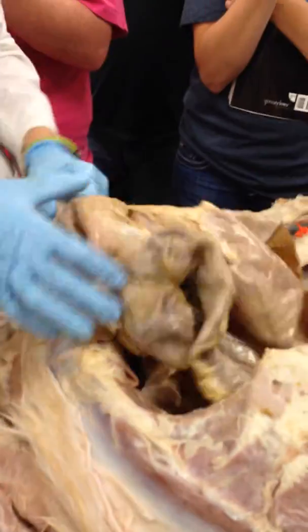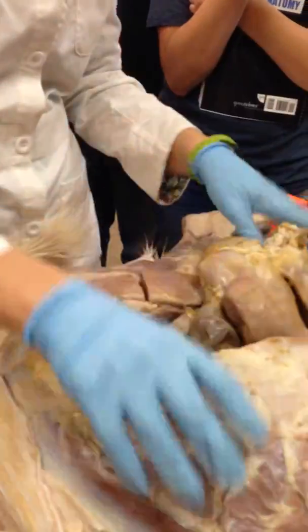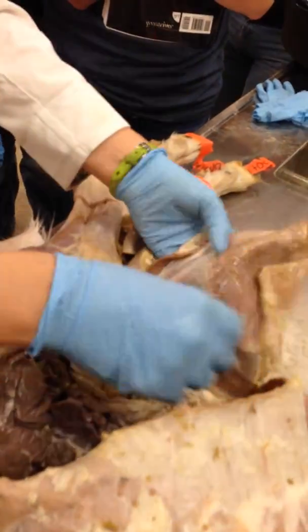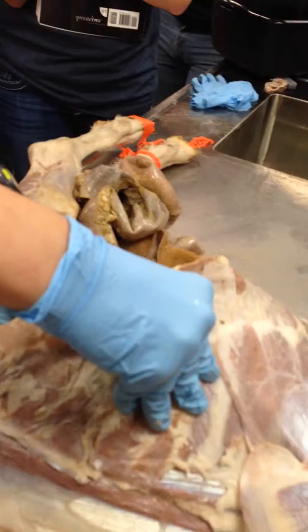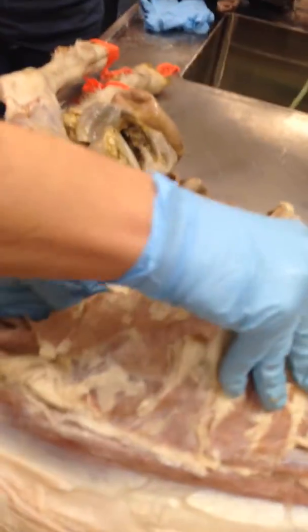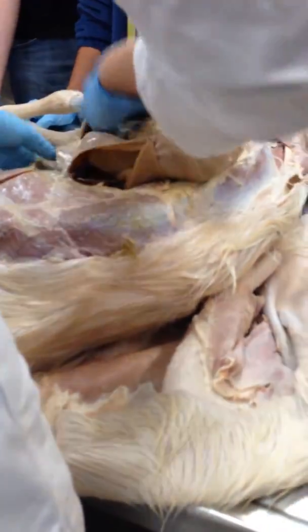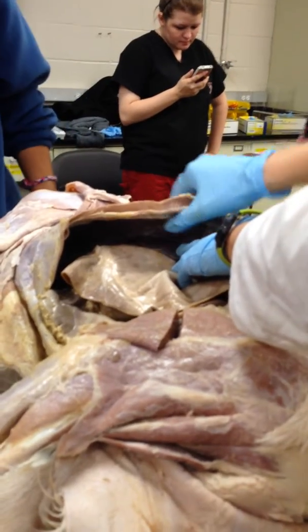And then on top, I don't know if we have it over here. Attached to the rumen is the spleen. No, it's over here. Right there, this is the spleen. So the rumen was laying like this. The abomasum is going to lie right there, going into the small intestine. The spleen lies right on top of it. So this is the spleen.